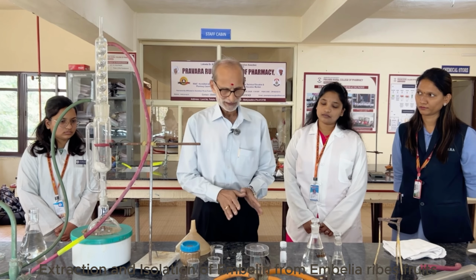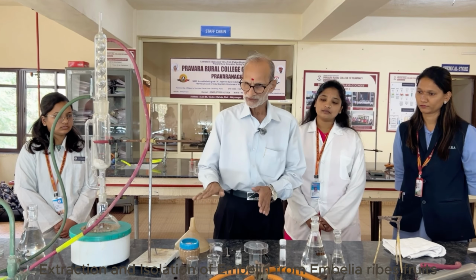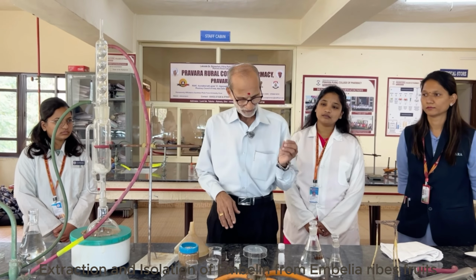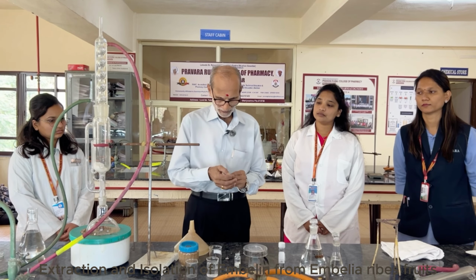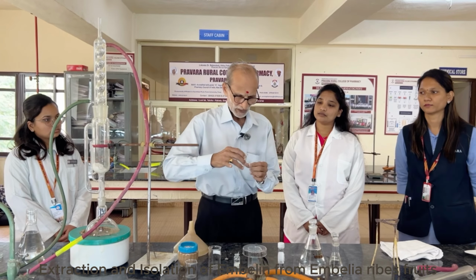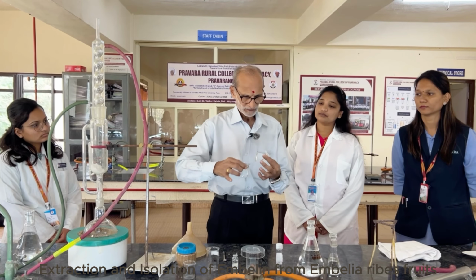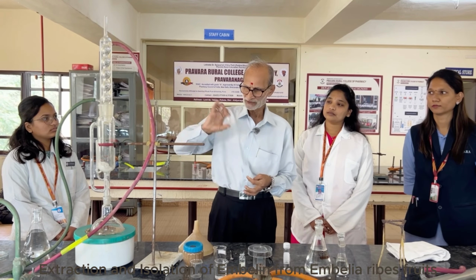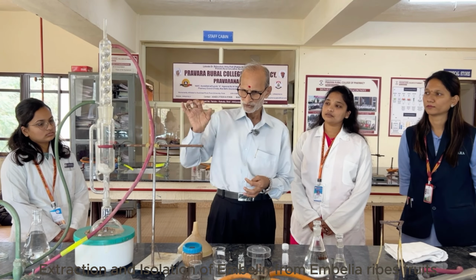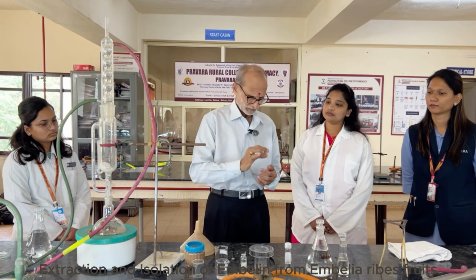Before that, we will ascertain whether the embelin is present in the powder or not. Here we have a standard embelin which is obtained, and we are going to make a solution in methanol, against which we will confirm whether our powder has embelin content in it or not. So this is a standard embelin. Now we are ready with a solution in methanol.